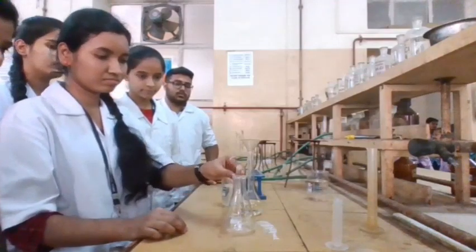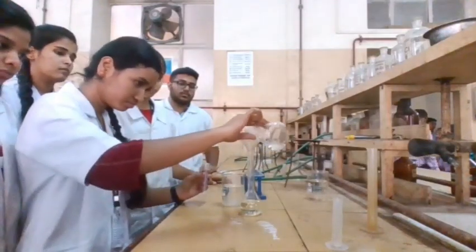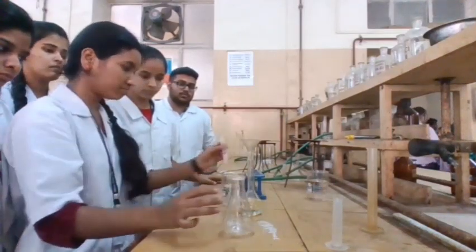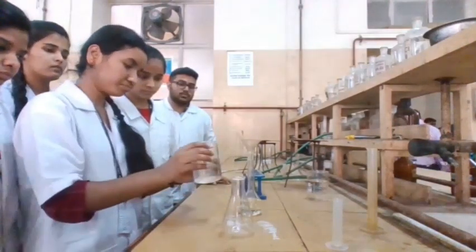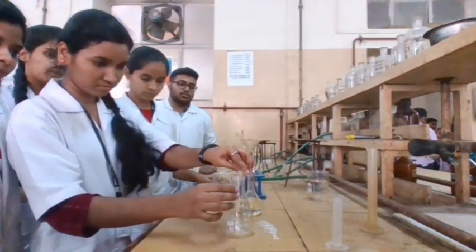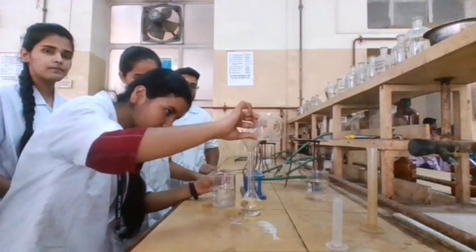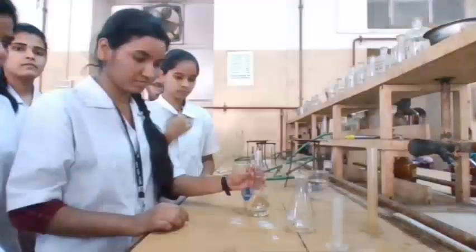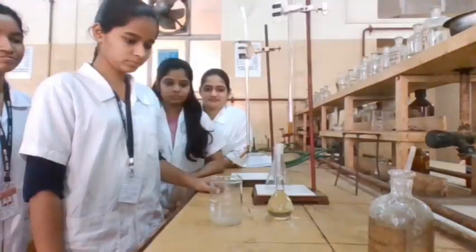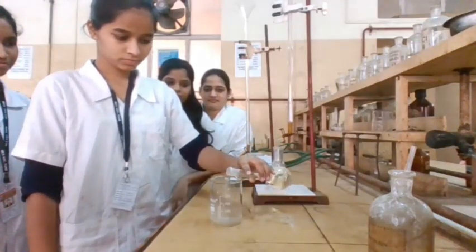Wash the conical flask and make up the volume to 100 ml using distilled water. This is the stock solution of the sample. Transfer the stock solution into a clean and dry beaker to obtain a homogeneous solution.